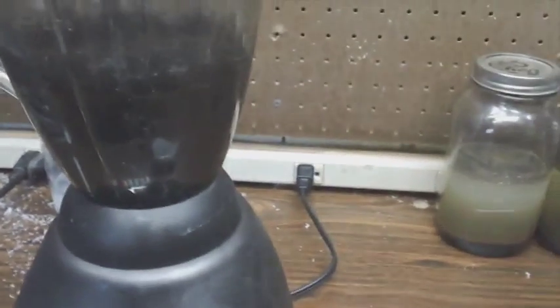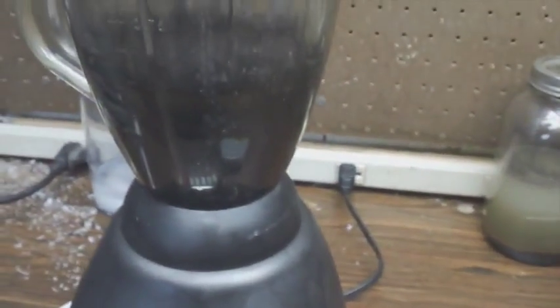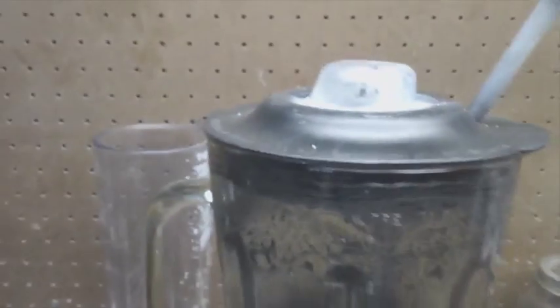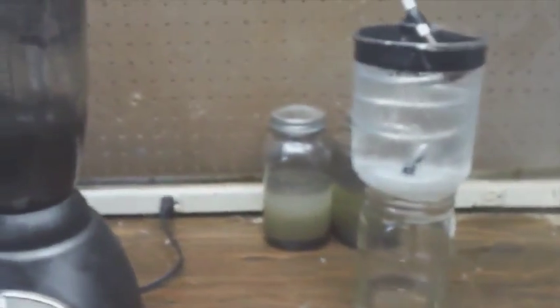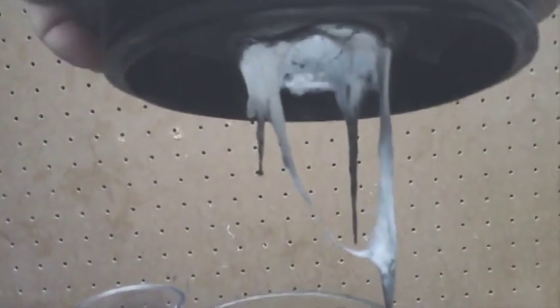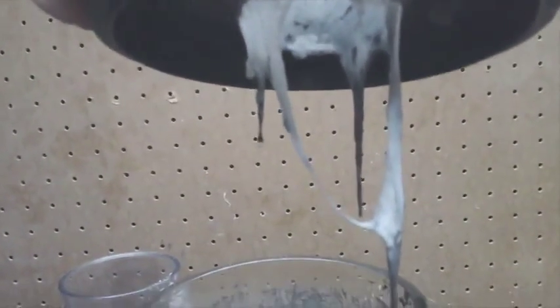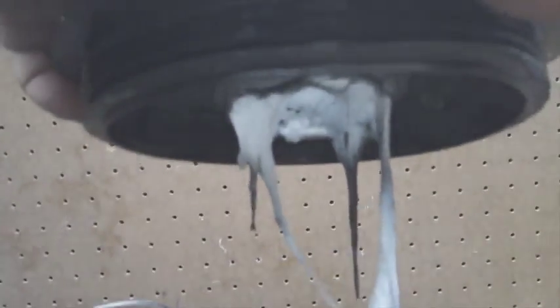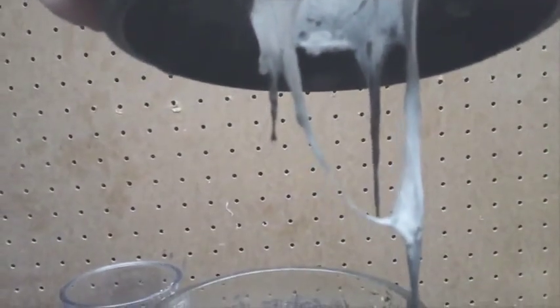Okay, that's it. Seven hours I ran the graphite. The yield looks pretty good. I moved it to this room so I didn't have to listen to the blender, but I did have to change blenders because the top part was melting on the other one, and it's melting on this one too. The top will have to be replaced.